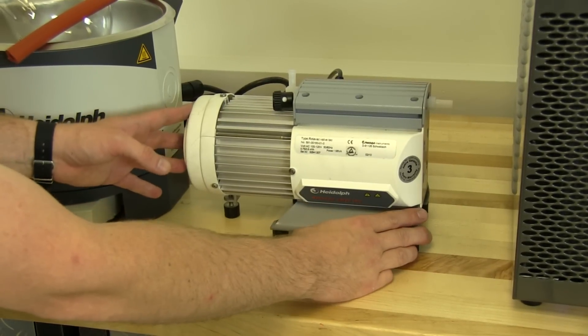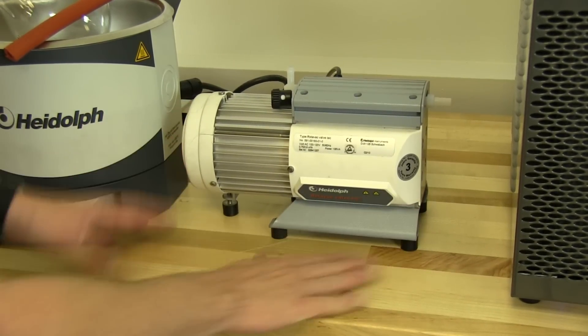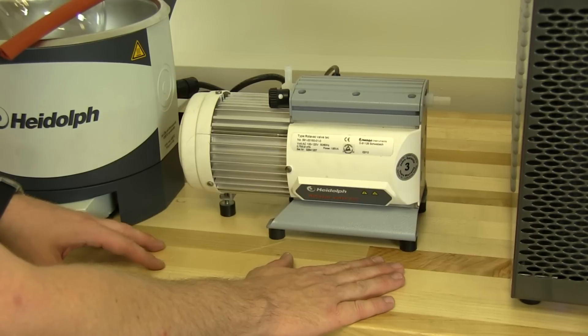Okay, so we pulled the vacuum pump out from the rear of the unit just to show you how to connect the vacuum tubing onto it.